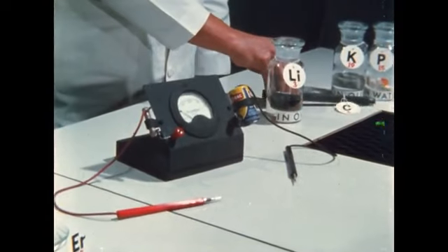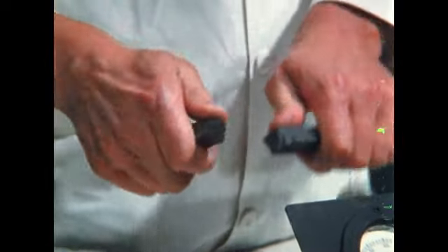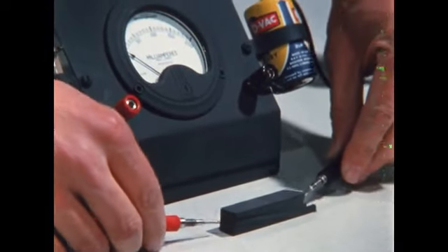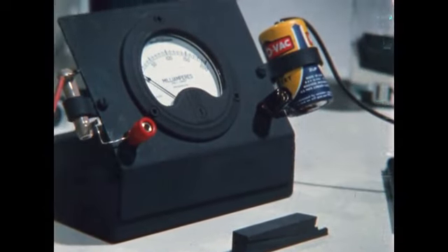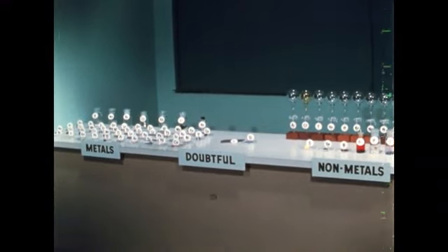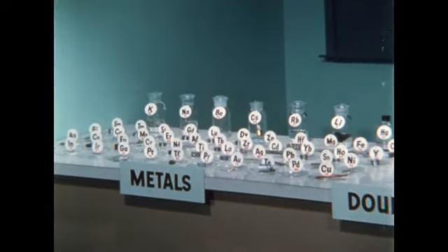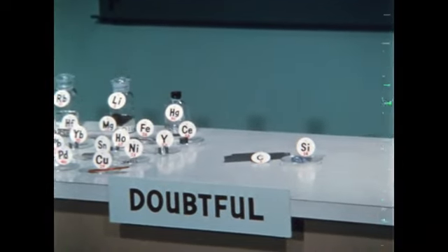We come to carbon in the form called graphite. It is not very shiny, and it breaks rather than bends under stress. Carbon is hardly metallic in these properties, but look, it is an excellent conductor. It conducts like a metal, but is not very shiny or ductile. When the testing is completed, there are about 4 times as many metals as nonmetals. Using the criteria of shininess, ductility, and electrical conductivity, we find that carbon and silicon are doubtful.